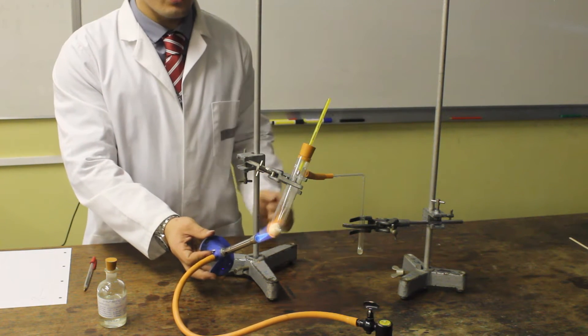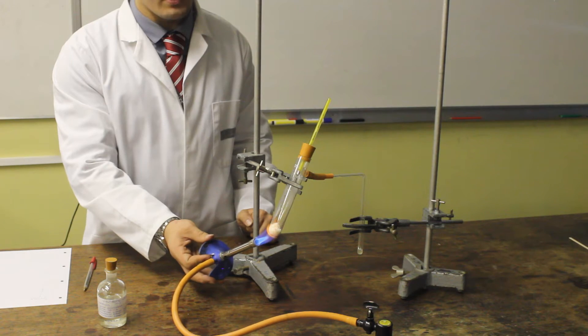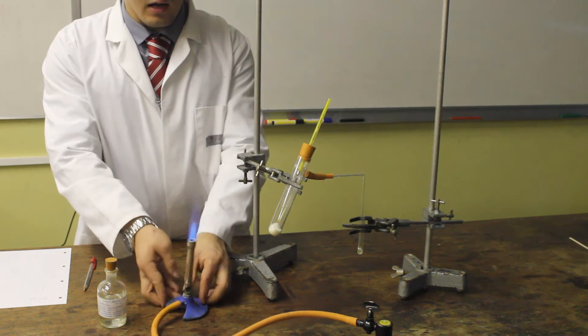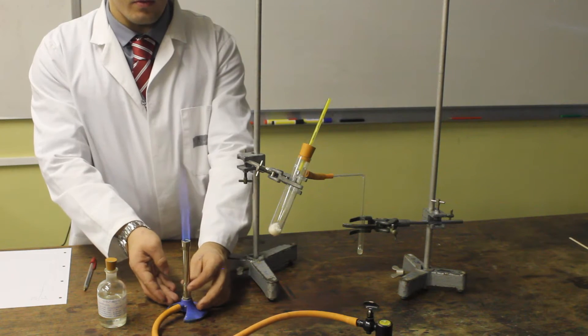Our first fraction has finished evaporating. At this point, I'm going to stop heating, and prepare the second delivery tube for the next fraction.